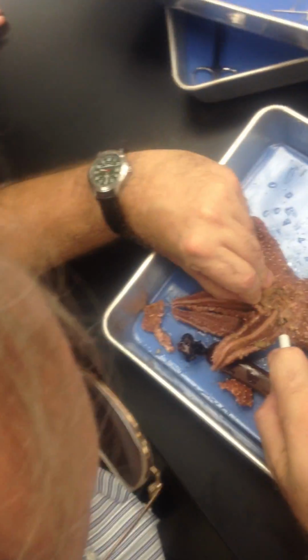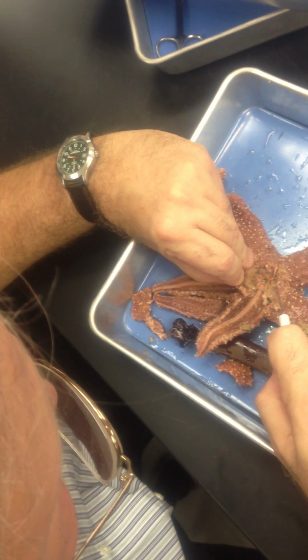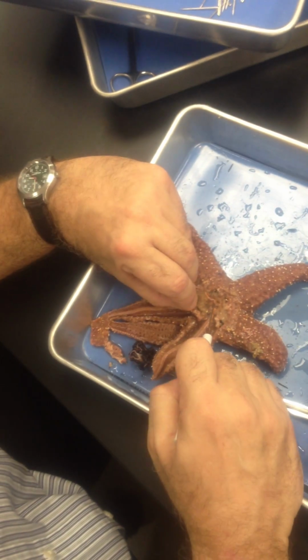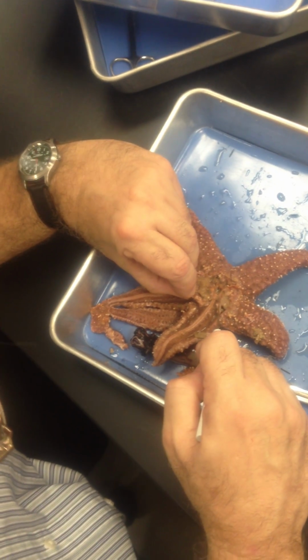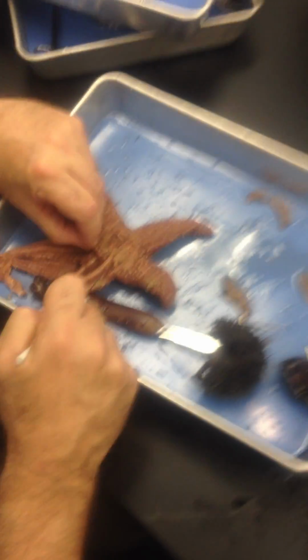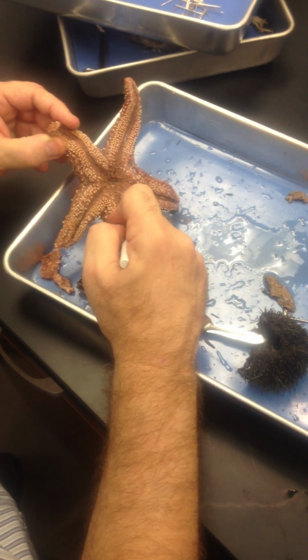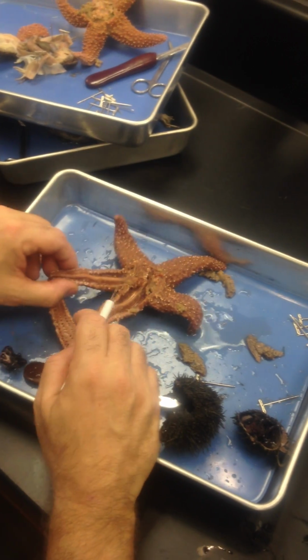Right there. How cool is that? Right there. Let's make sure that is sweet. That is the stone canal. Madreporite, stone canal attached to the ring canal, out to the radial canals, to the lateral canals, to the ampullae that move the what? Tube feet. What is the technical name for the tube feet? Podia. I could ask that on a practical.